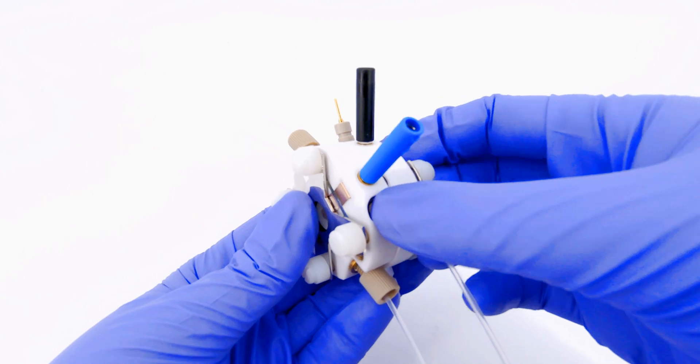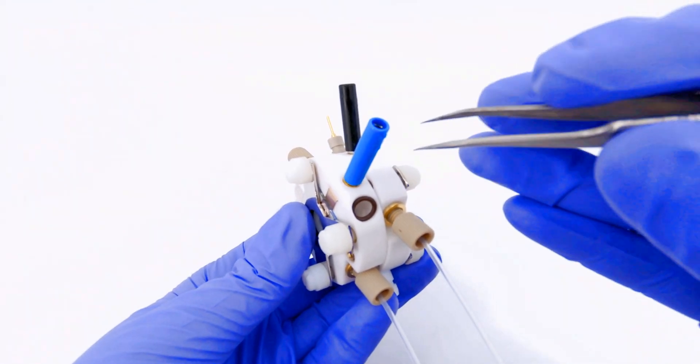Ensure a gas-tight fit for the reference electrode, make sure the o-ring fits into the inset in the port.